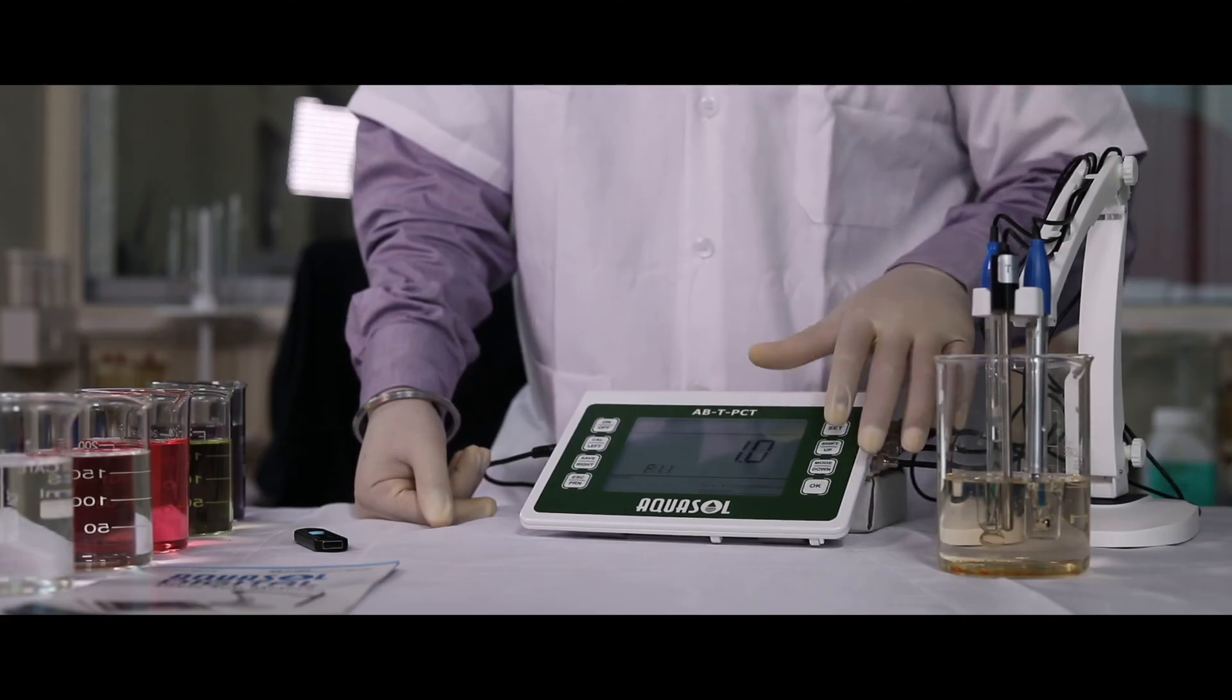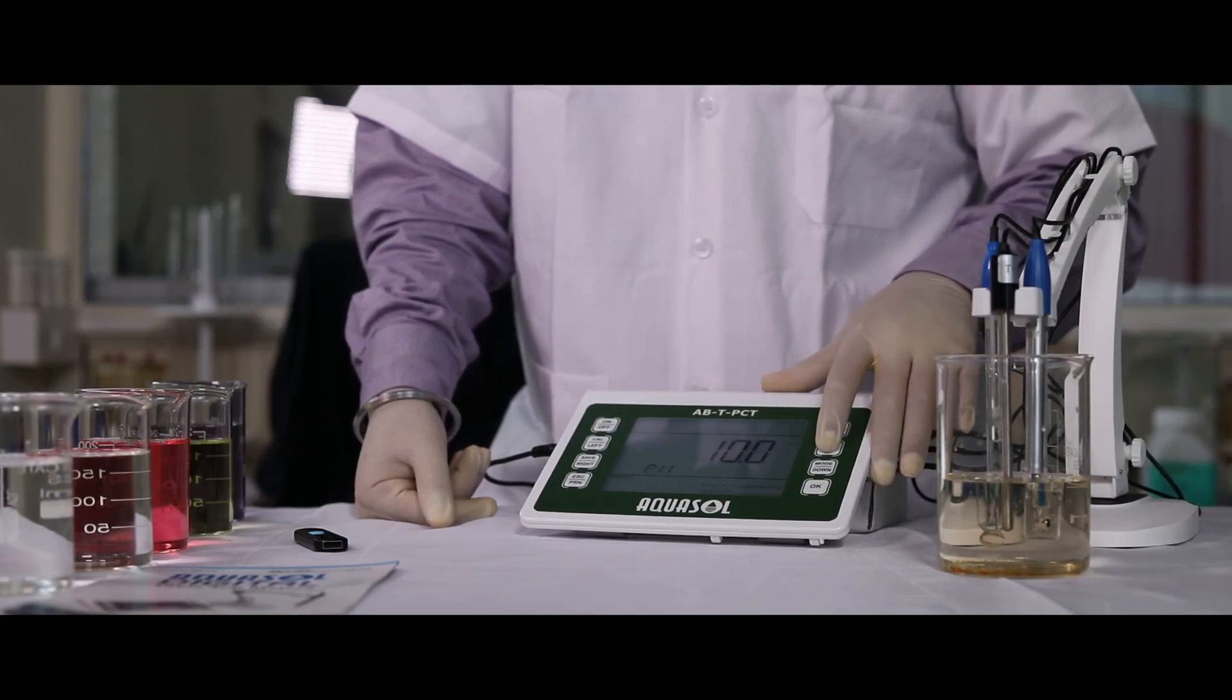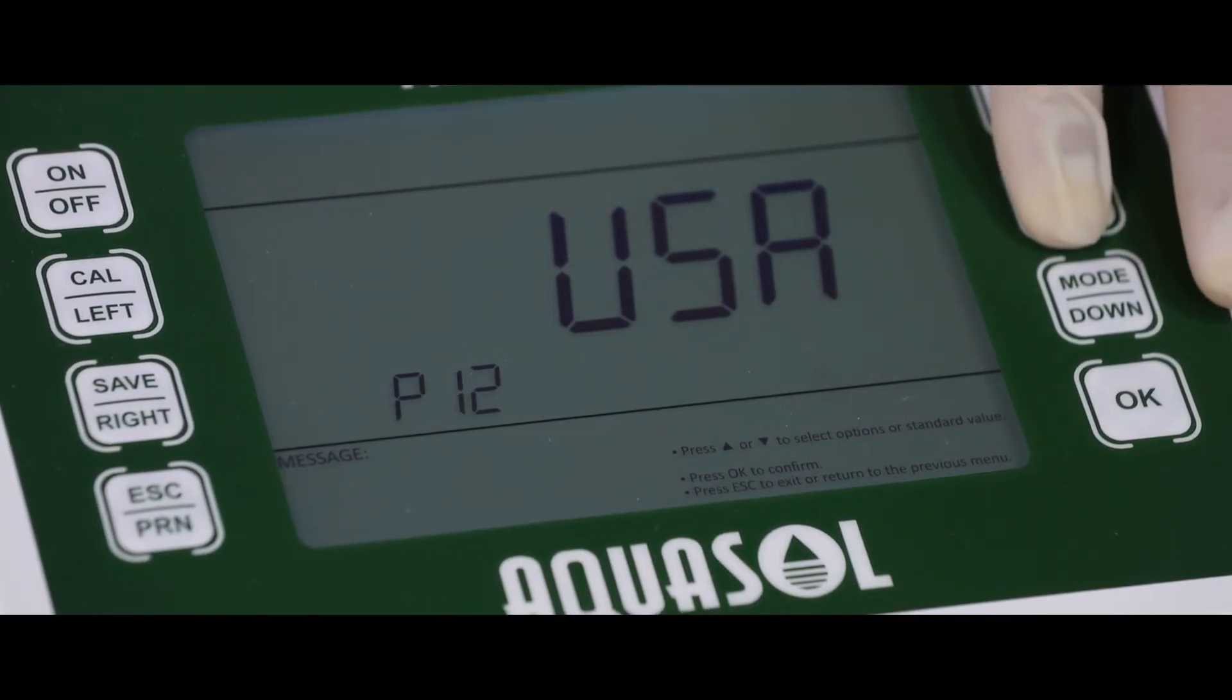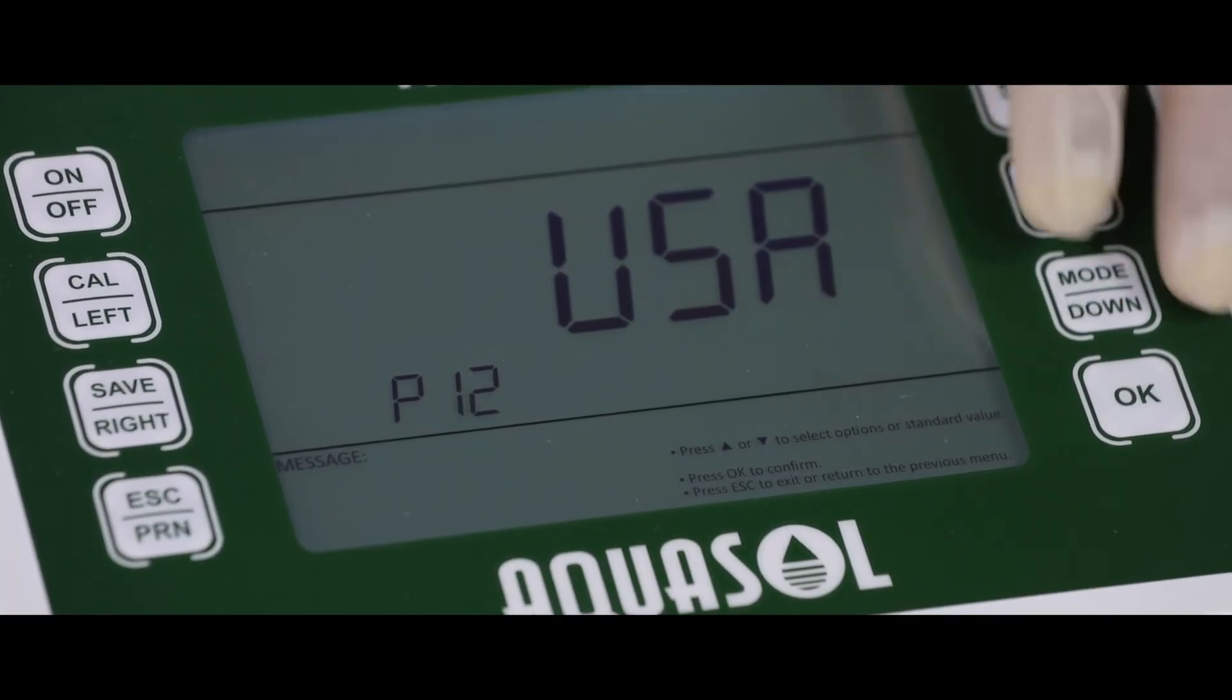P11, conductivity electrode coefficient range setting. P12, conductivity standard solution selection.